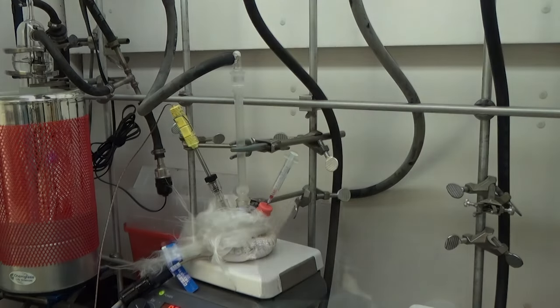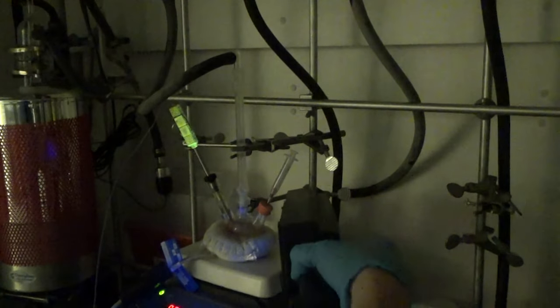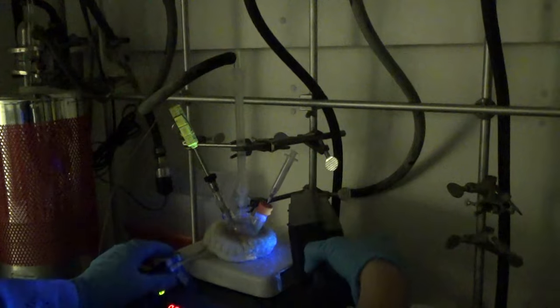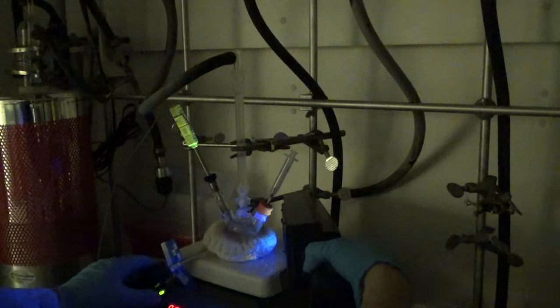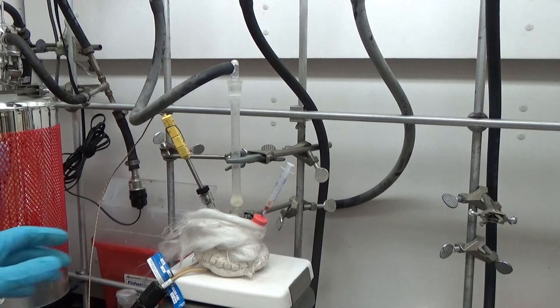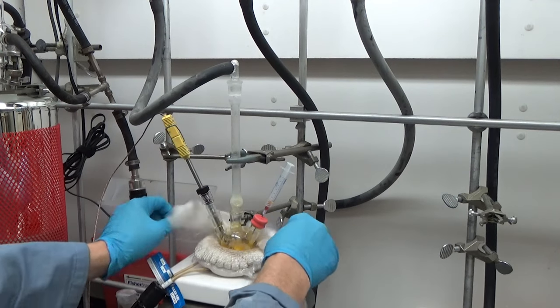Now I'm a little impatient. I can't wait to see how emissive they are. These materials, this is while it's still hot at 300. You're not seeing a lot of emission. So your eyes are telling you the truth. It's not very bright.